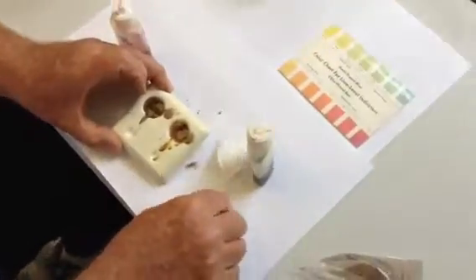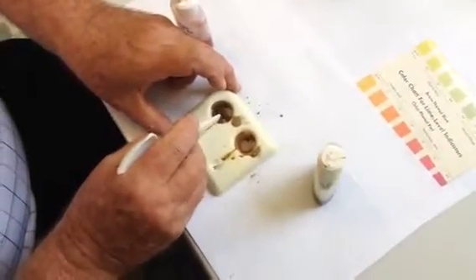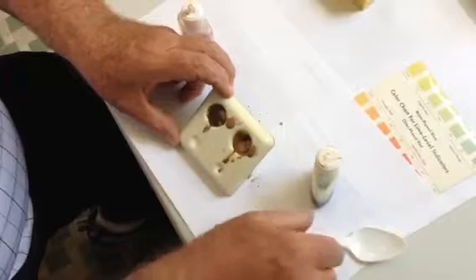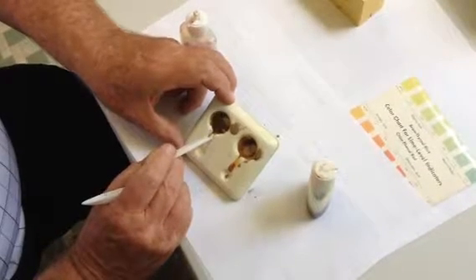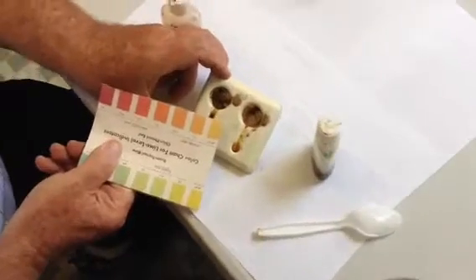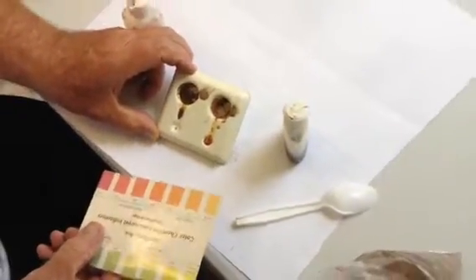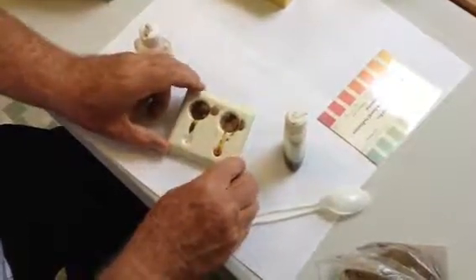So let's see how it compares with the red. We're going to try to be very careful and not make mud, because that's what happens when you play around with it. You draw this off again — I'm just using the spoon as a little something to coax the fluid out. And you can see where you haven't made mud, the color on that is dark yellow also. So we're pretty much off the scale even on the red side — we're in the 5.2 to 5.0 range. Now there are more wide-ranging pH kits, but this is the general one that we use with most agricultural soils.